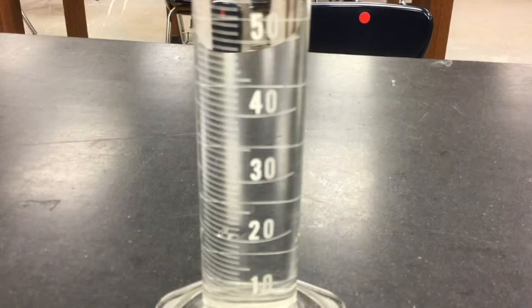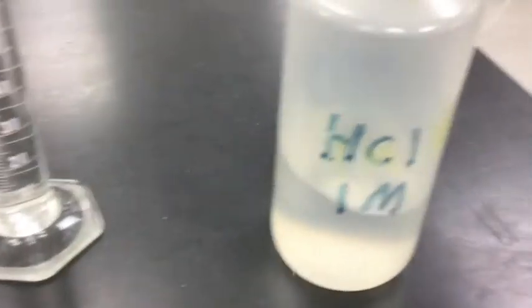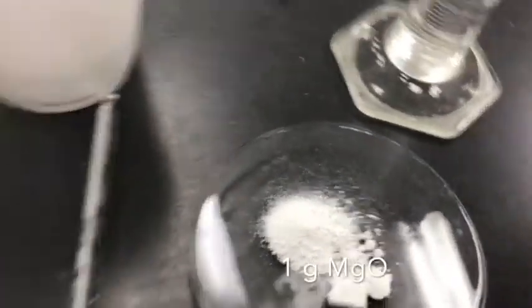So what I've got here is 100 milliliters of hydrochloric acid, 1 molar hydrochloric acid. And again, you'll just have to trust me that that's the case. So that's 100 milliliters of 1 molar hydrochloric acid. And then I have got 1 gram of magnesium oxide. So here is the magnesium oxide that I've been using.